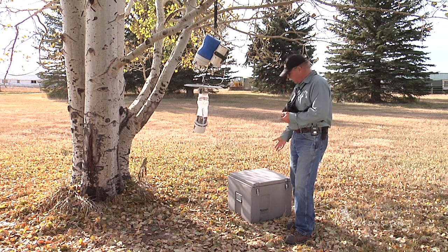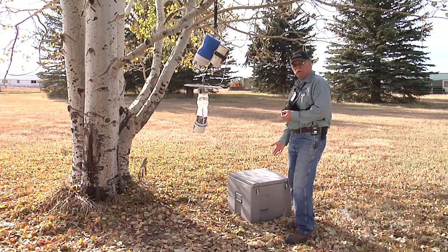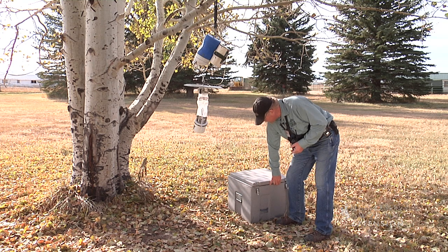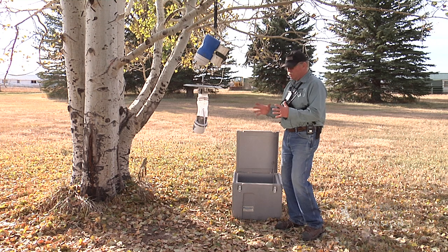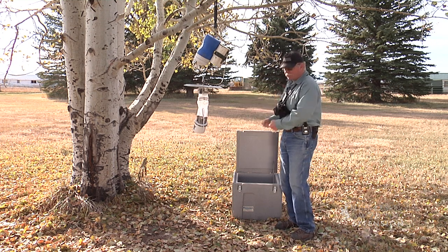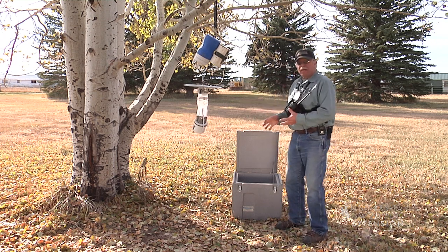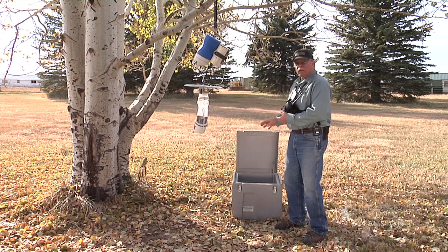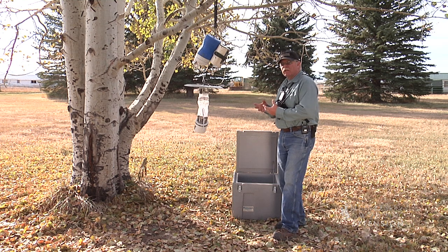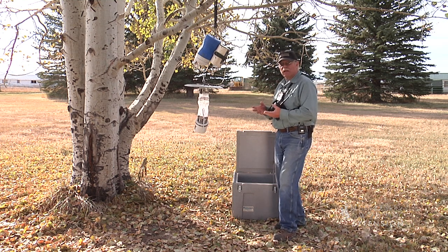In preparation before we came out today, we have a cooler for transporting our specimens. Inside the cooler we've placed a single eight-pound plate of dry ice at the bottom. That plate of dry ice keeps the mosquitoes cool, and the volume of carbon dioxide that comes off of it anesthetizes those mosquitoes and knocks them down so they're not flying around and beating themselves up.